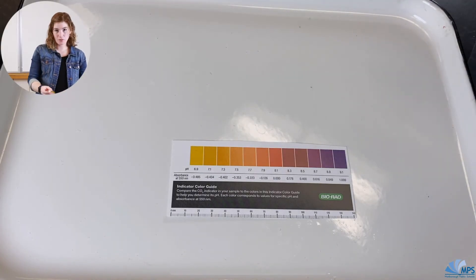So we've looked at lots of different results today — what happens when you put the algae beads under regular white light, under a red lamp, under a green lamp, in natural sunlight, and in the dark. You're going to use these changes in pH to answer some questions and write a conclusion about what these different conditions do, what process takes over, and how this relates to photosynthesis and cell respiration.